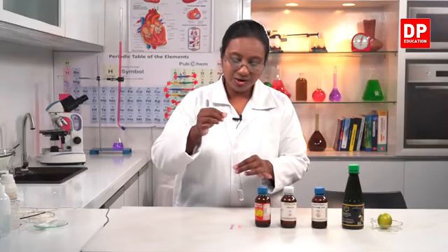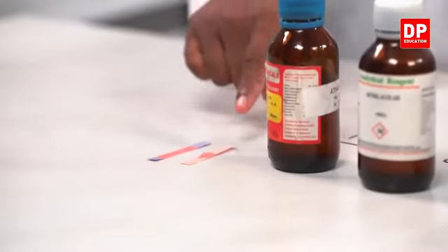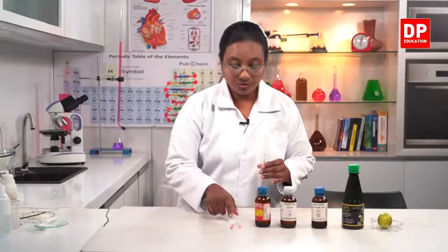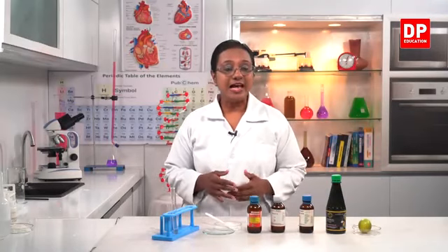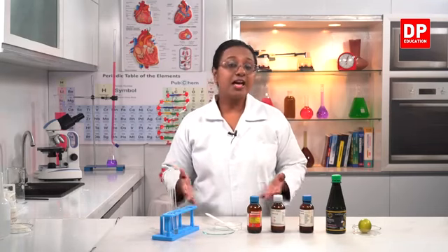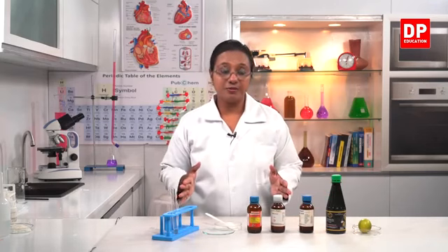So now can you all observe the color change? The blue litmus turned red, but the red litmus remains the same. So to identify acids, we use blue litmus. Blue litmus will become red. So one of the uses of sulfuric acid is that the concentrated sulfuric acid can be used as a dehydrating agent. Even the gases can be dehydrated or dried passing over sulfuric acid.